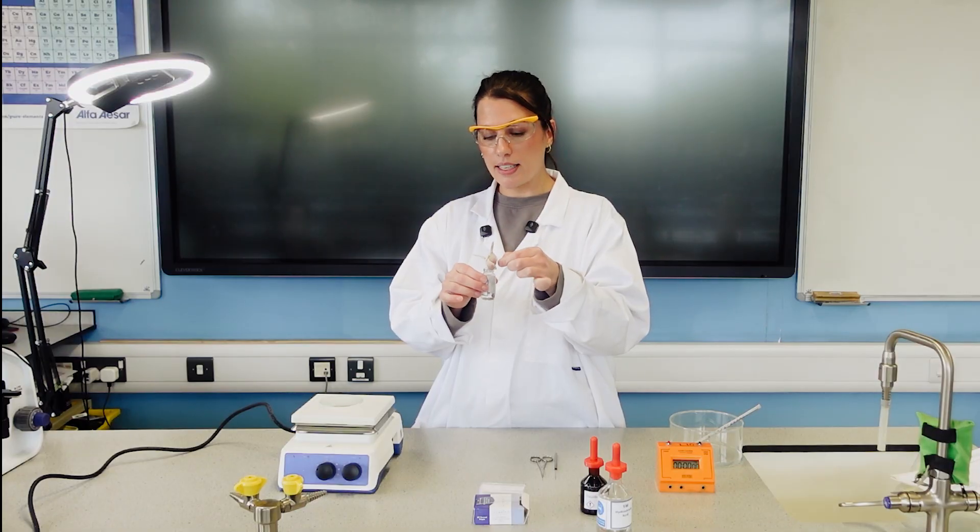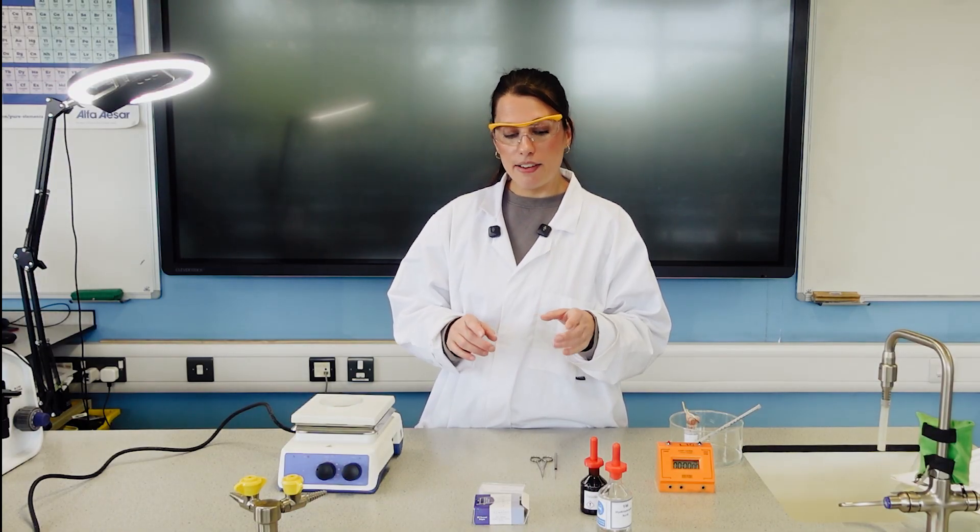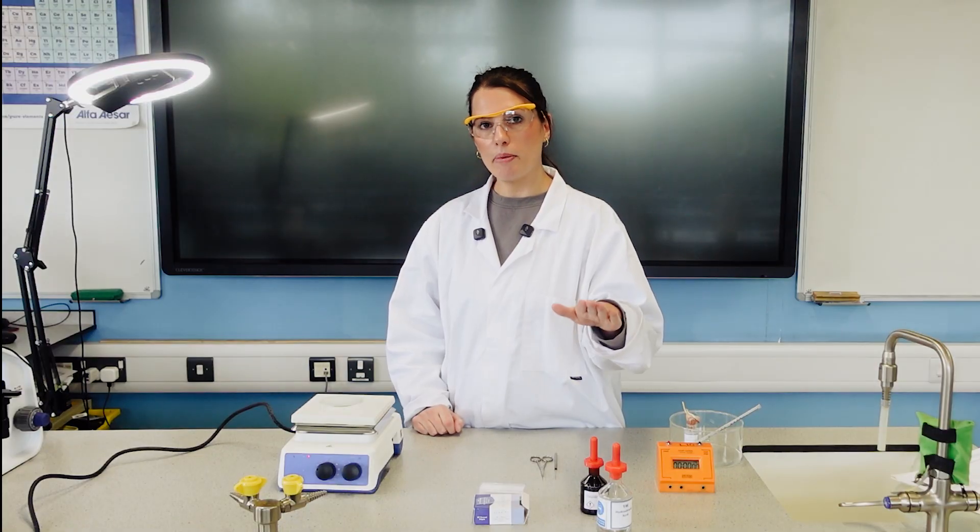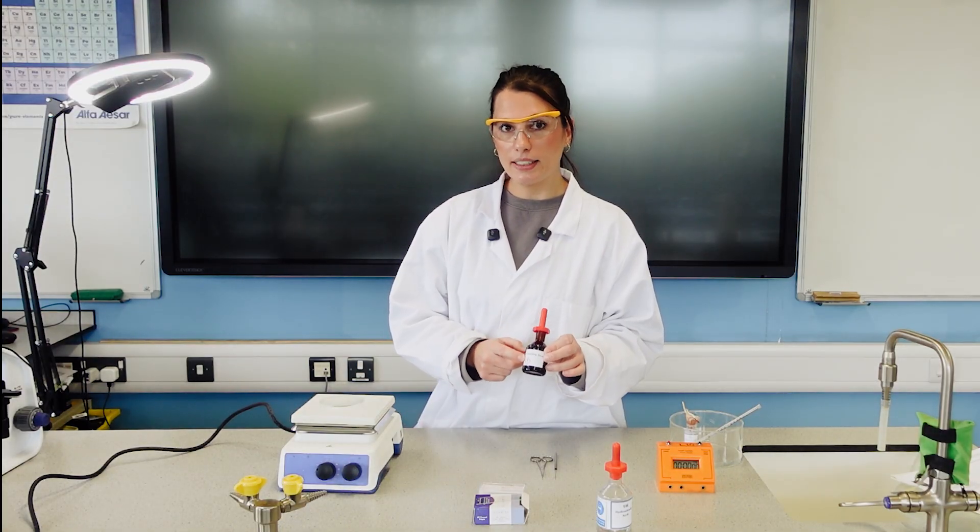We need to make sure we're using the same age garlic each time. Ideally it'd be from the same garlic, same age. We'd need to leave it in the acid for the same amount of time and use the same volume and concentration of our indicator as well.